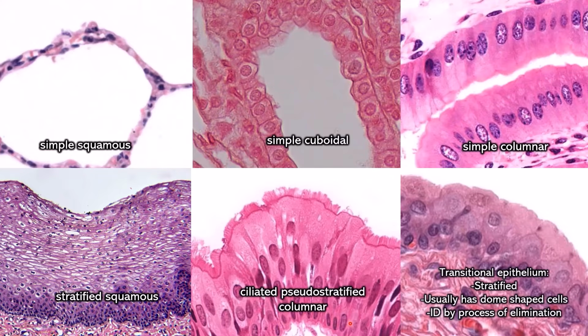And last but not least, our problem child, transitional epithelium. A lot of students, after watching my first video, still had problems with transitional. That's why I included a lot more examples in this one. The thing about transitional is it can look very different depending on where the sample came from, but it is always going to be stratified, meaning it has multiple rows. Usually you're going to see dome-shaped cells, and nuclei that are poorly organized, meaning they're not in nice, neat rows. They're kind of all over the place.